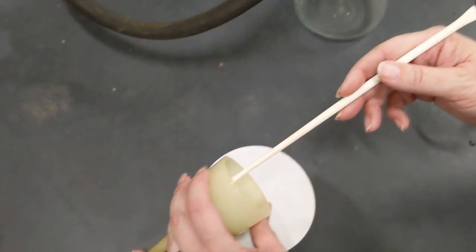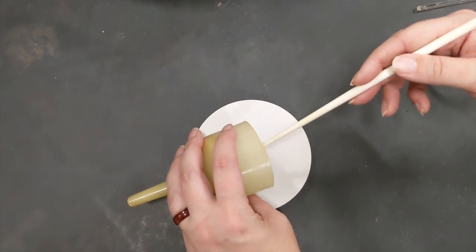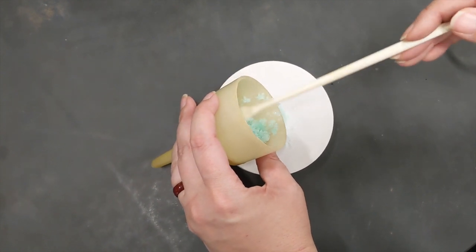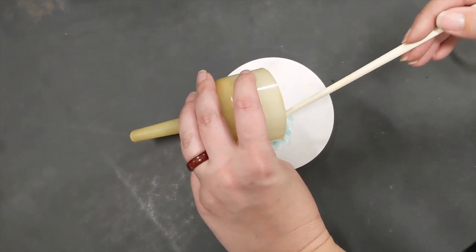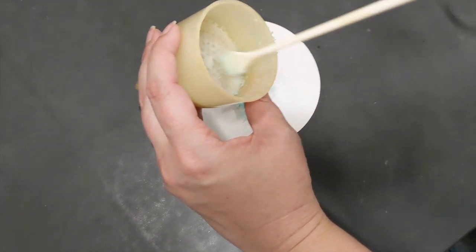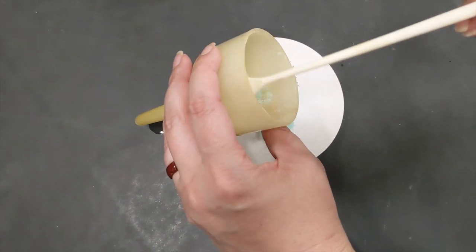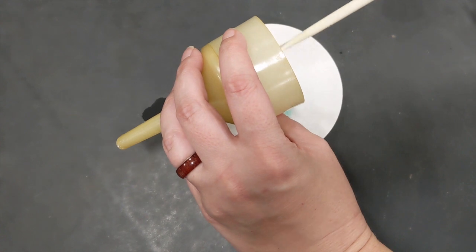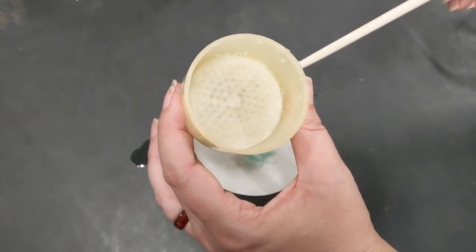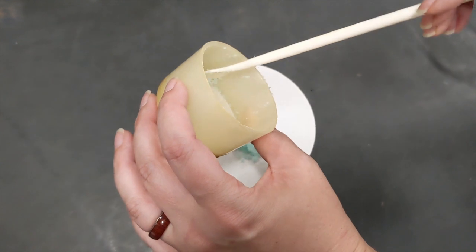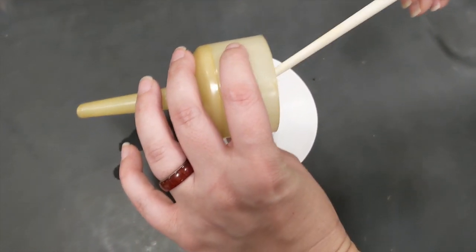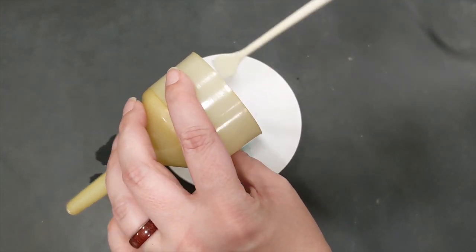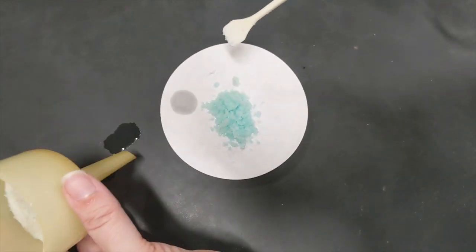So I'm going to scrape these crystals out. My little filter paper may not come with me. If so, I was going to pick it out of there. So I'm scraping most of these crystals out here because again, I'd like a good yield. But I know for a fact I won't get all of them. Right? We can see that there's some left in here. And even though I'm going to try to get a little bit more out of there, I will not succeed in getting all of it. All of these are reasons why our percent yield at the end is going to be less than a hundred percent.